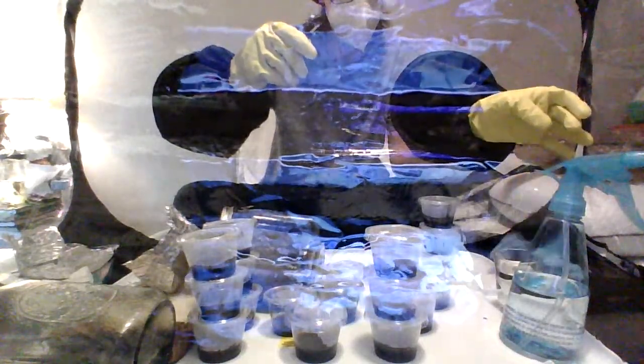All right, I want to say that's effectively... Oh, hold on. It's such a good thing to have light when you do this. When you have your little tiny light like I have up here, it's good to have that extra bit of light when you're doing stuff like this, for sure. Stuff is clear, but it's somewhat opaque. There's a little bit of blurriness. You can clearly see through it, but no matter what, it's good to have some extra light. That's all I'm really saying.